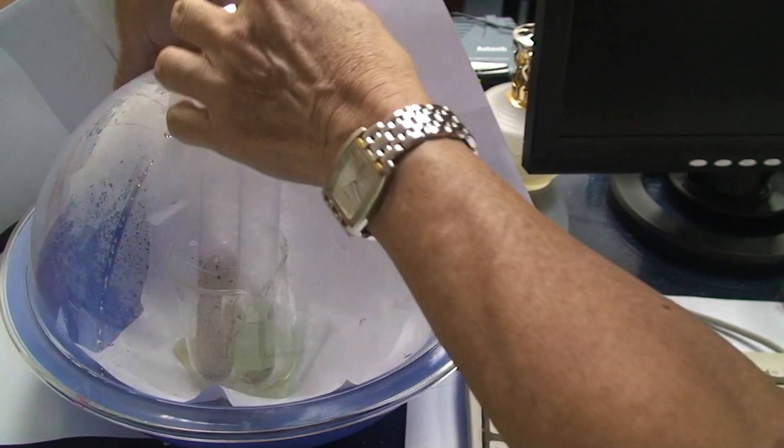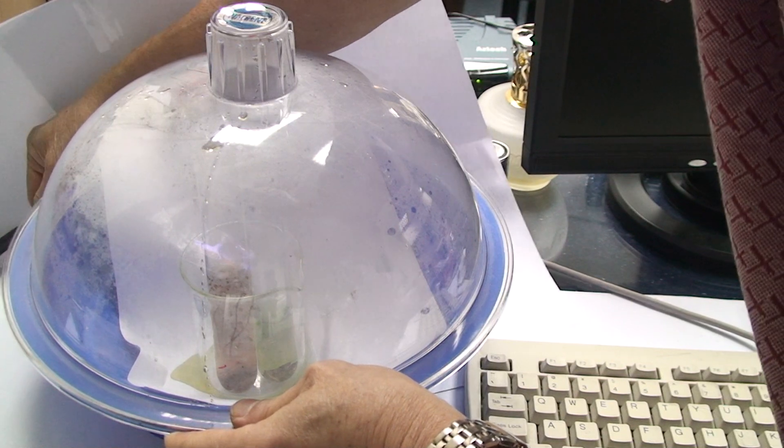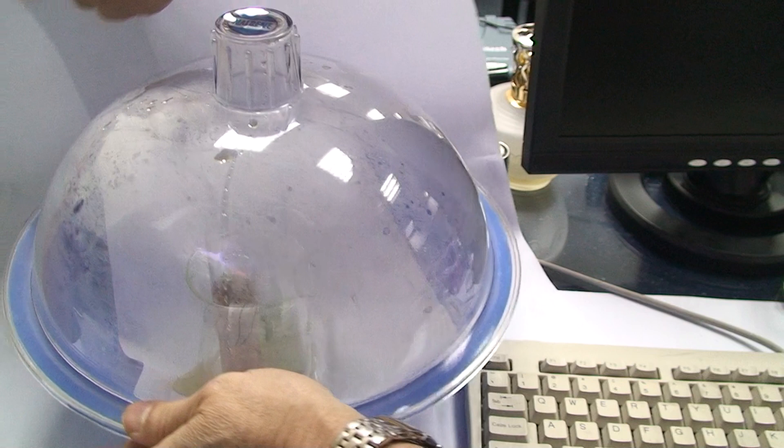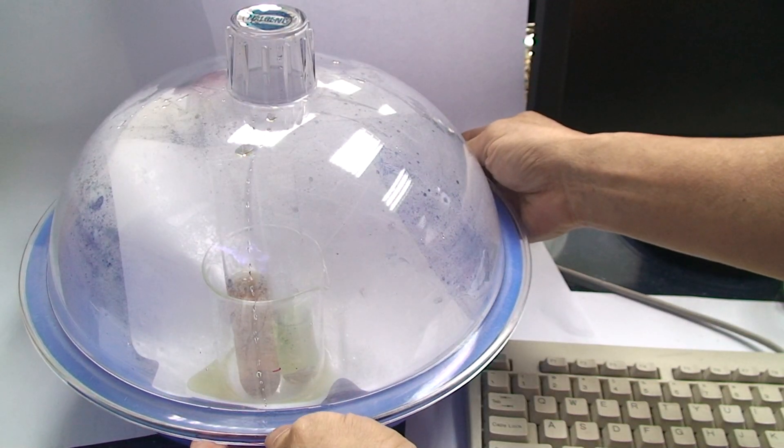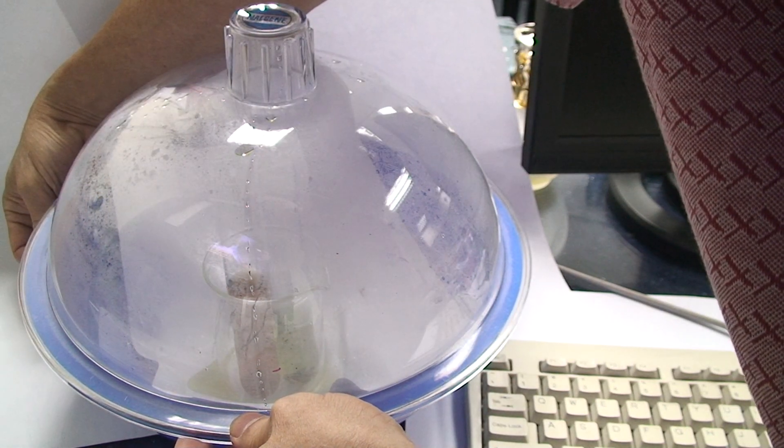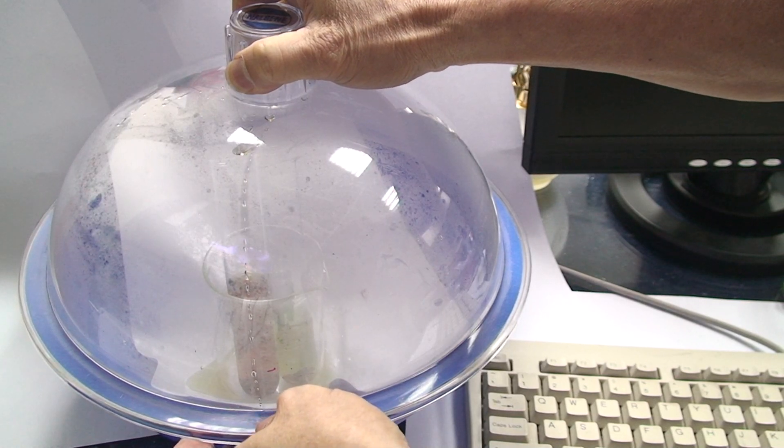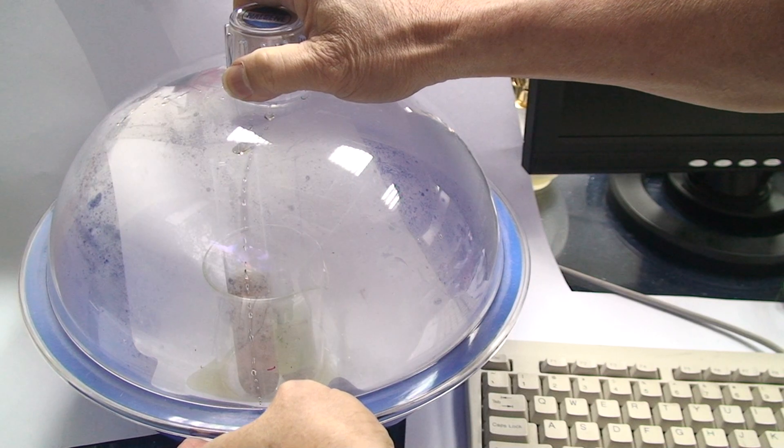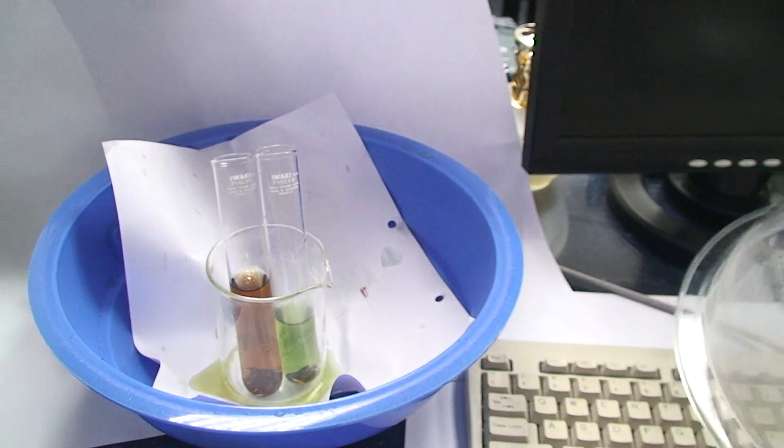So we're going to let air back in here. And of course, once I let air back in, it is easy to take out the cover now, hopefully. Okay, now I can remove the cover.